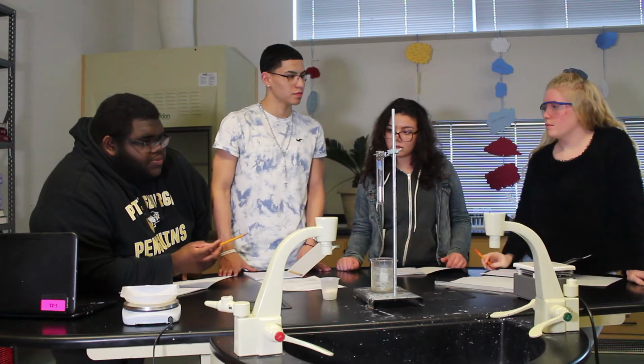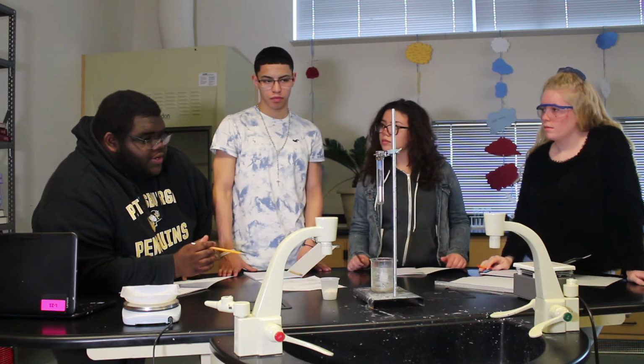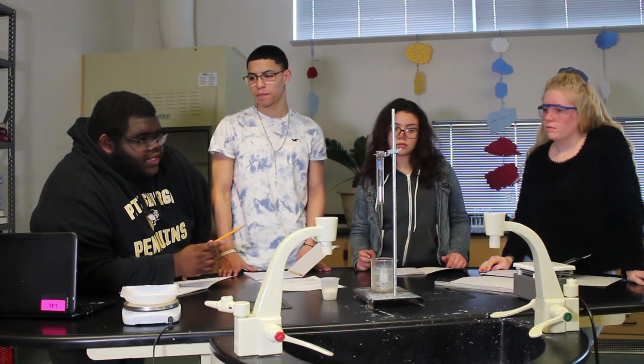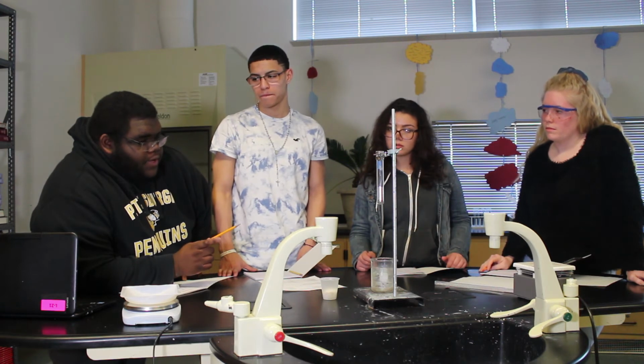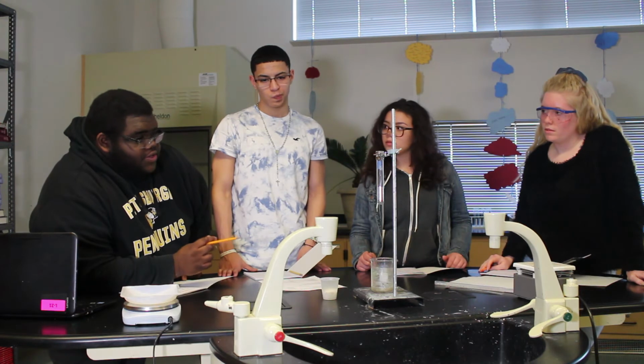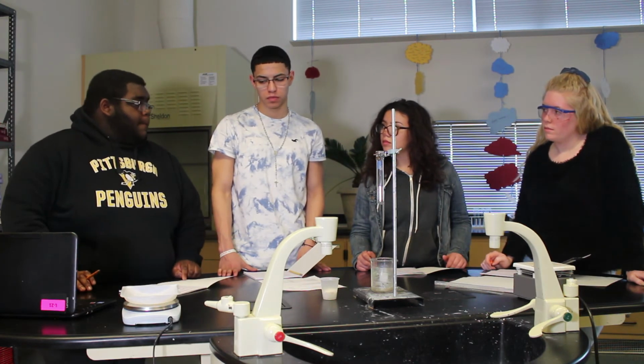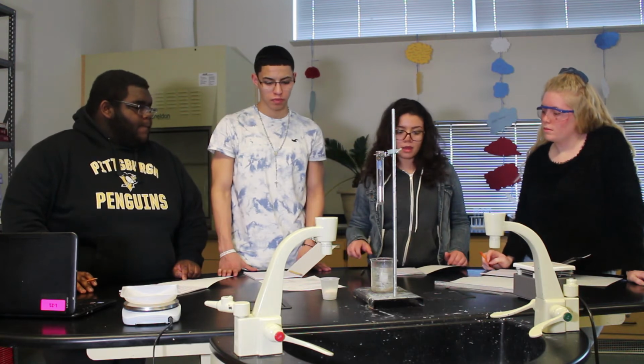Wade started out in the beginning, so he was kind of like a leader then. But we're all kind of putting in our own ideas. In my theory, we should put the chemical in the test tube and then submerge that in the water. We can measure the temperature of the chemical by just putting the thermometer into the tube. Okay. Yeah, I agree.